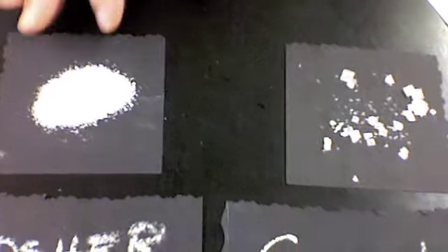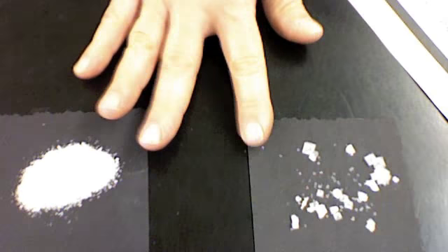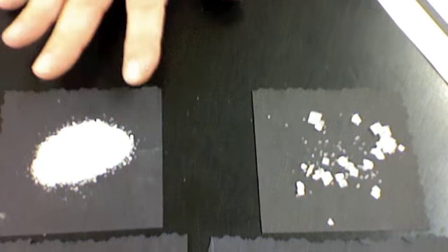Exactly. And then our last question is, does the salt look the same as it did originally? You need to explain that, and we'll show you, again, for those of you that weren't here, what we started out with and what our end product looks like. We selected some large, beautiful crystals and put them on black paper so that you could really notice the properties of a crystal and the properties of kosher salt.